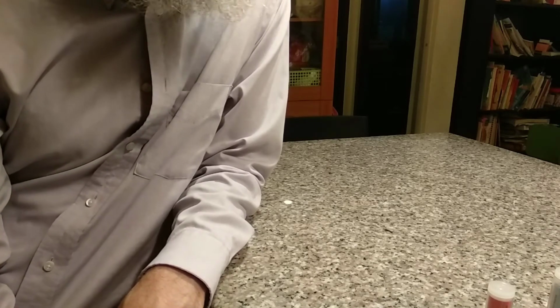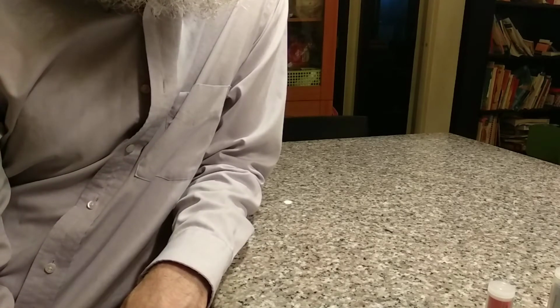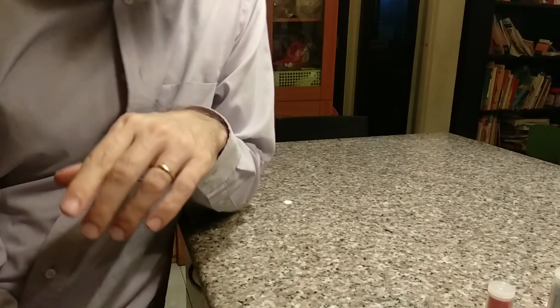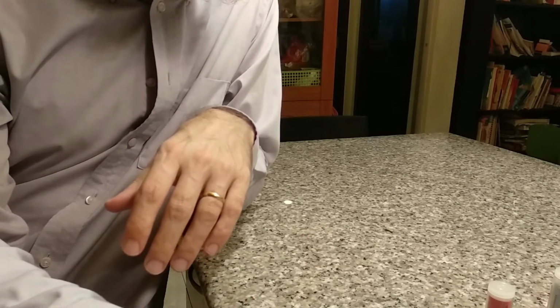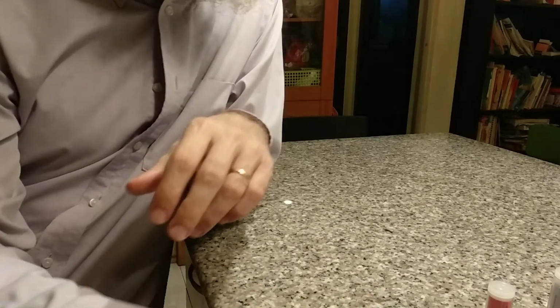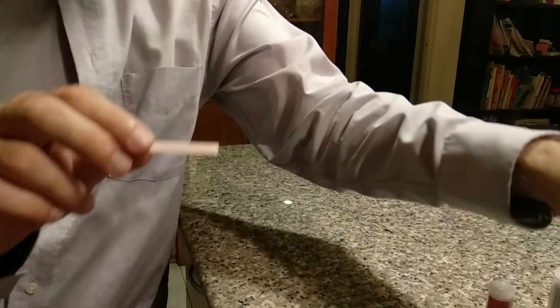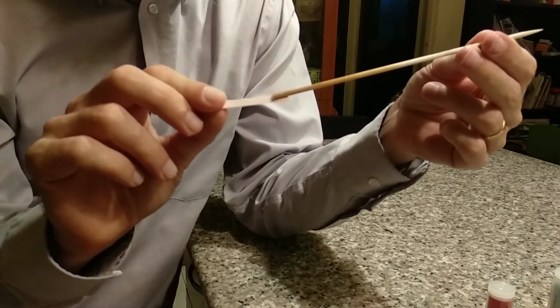If you've ever had cookies or muffins that had too much baking soda put into them, and you take a bite, usually first it tastes real nice, and then you get that bitter taste that goes all through your mouth. So that would be one characteristic of a base. They also can change the color of indicators. So again, here's my red litmus paper, and this time if I take my baking soda water and put it on, what do we see?